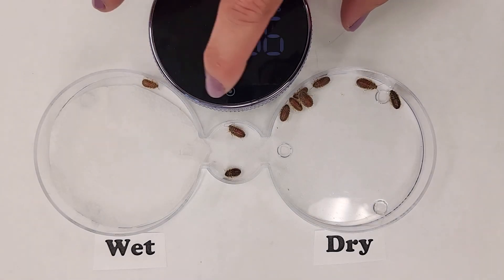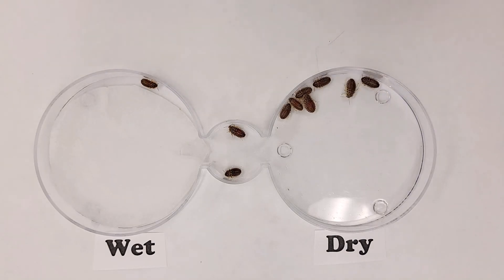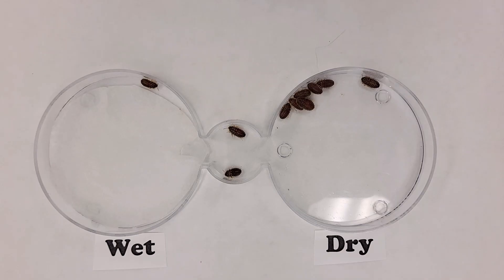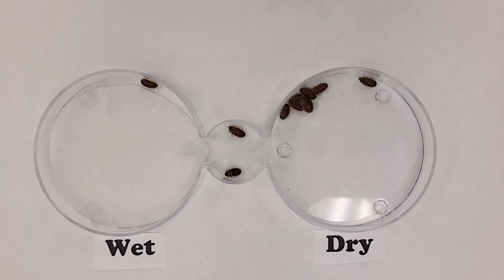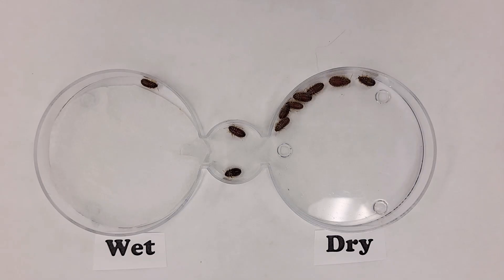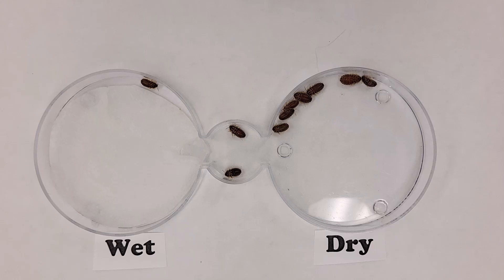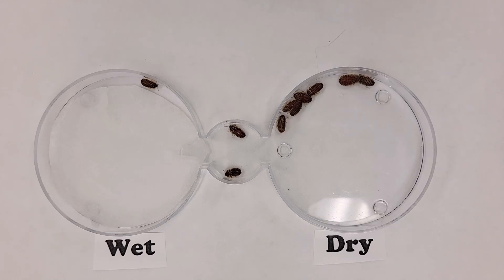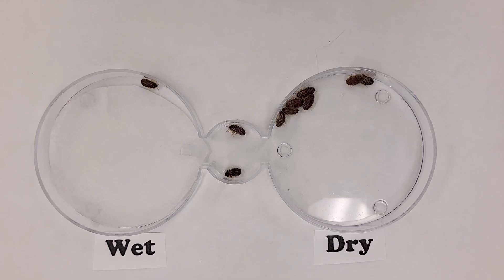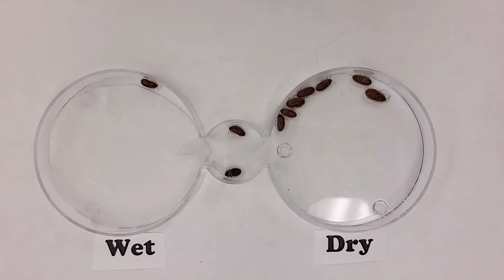There's our 10-minute mark. So that concludes the animal behavior lab. Now we can graph our data, we can analyze our data, and we can even do chi-square analysis to see if there is a statistical difference between one side versus the other. There are all kinds of experiments you could set up in the choice chamber — lots and lots of different choices. These are just a couple of examples for collecting data.